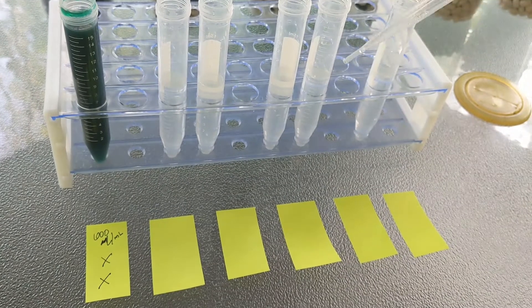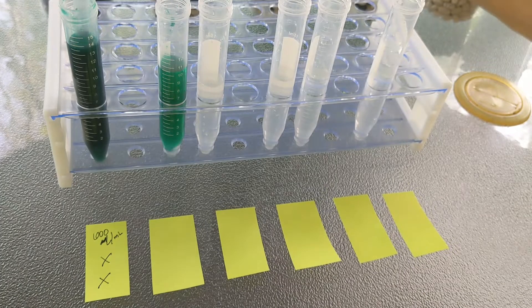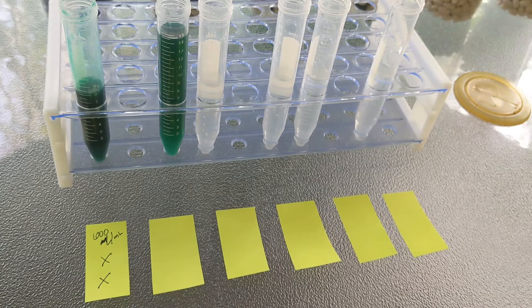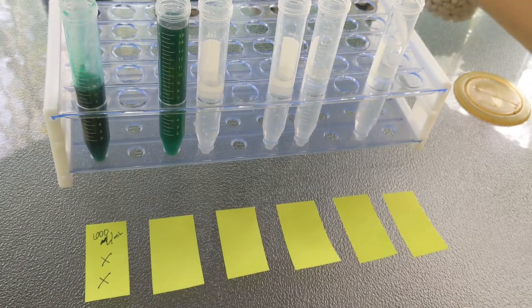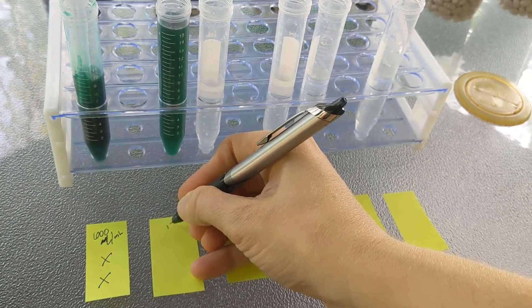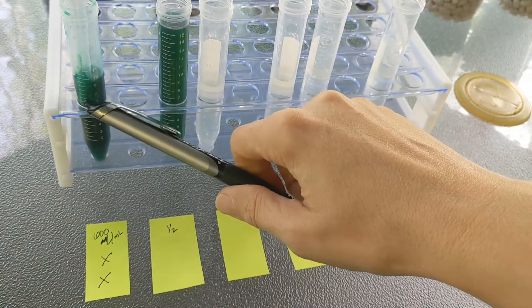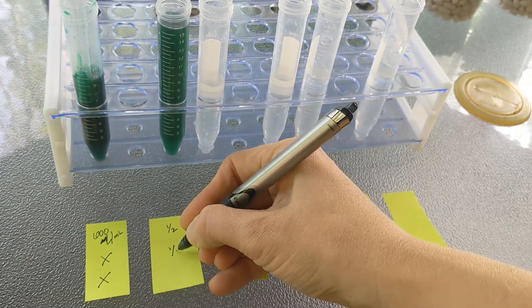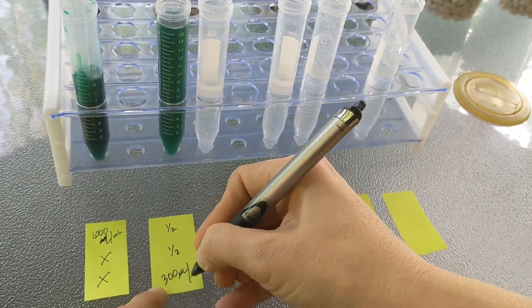I'm going to fill them the rest of the way — just the first one with the initial solution — so we should see it diluting. The color is decreasing just as it did with the beans. Now let's do the tube dilution. The tube dilution is one-half because we transferred half — it's half solute and half solvent. The initial dilution is one-half and the final dilution is also one-half because we've only done it once, which means we take half of 600. Half of 600 is 300 microliters per milliliter.